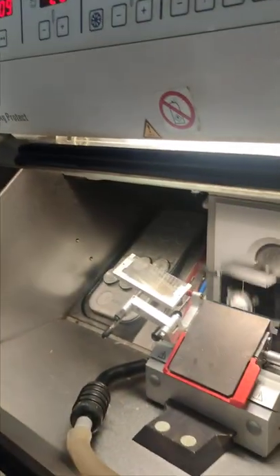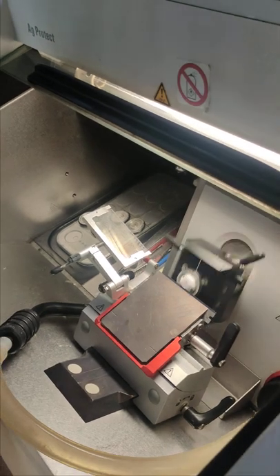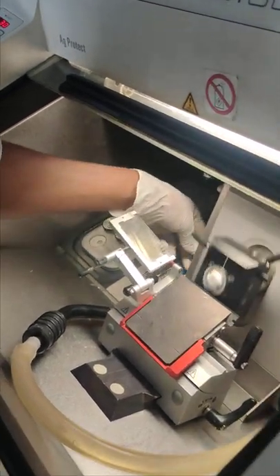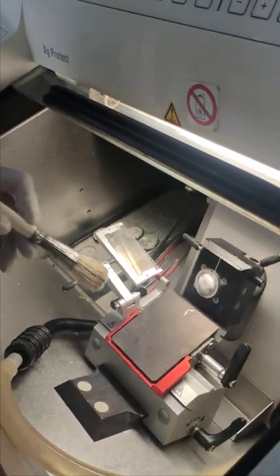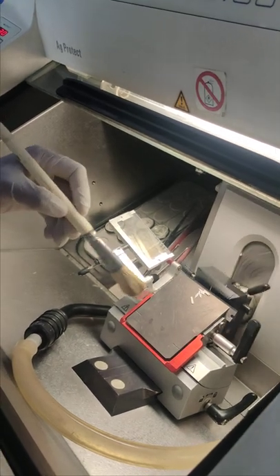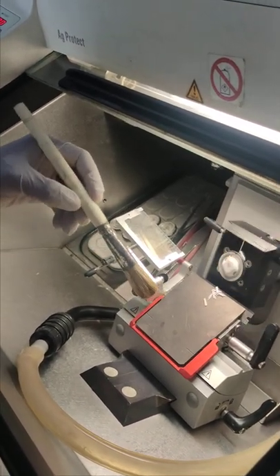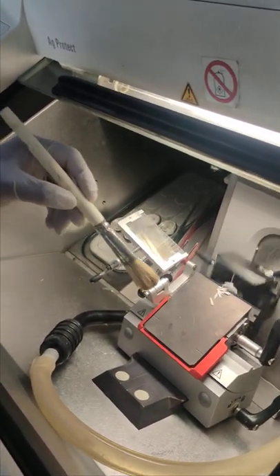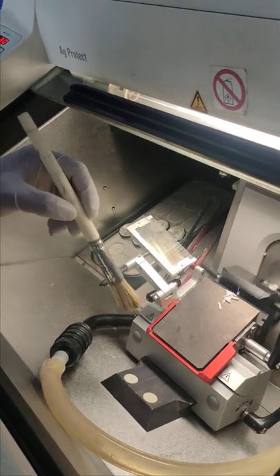We start trimming with a rotatory movement. We need to remove the excess ice gel that covers the tissue to let the tissue become exposed.